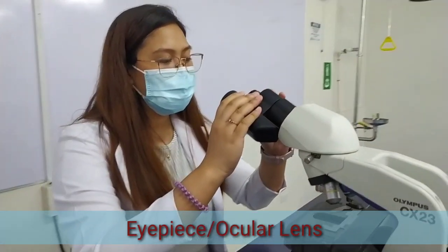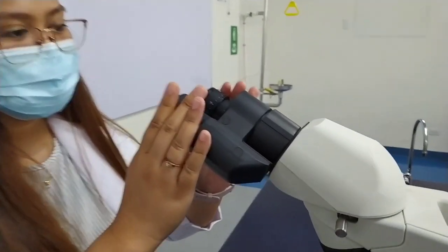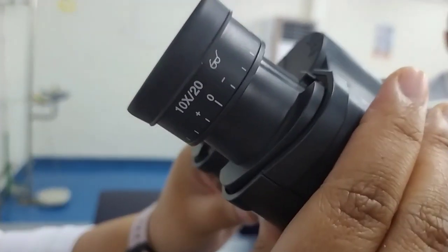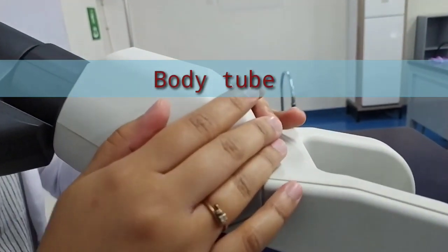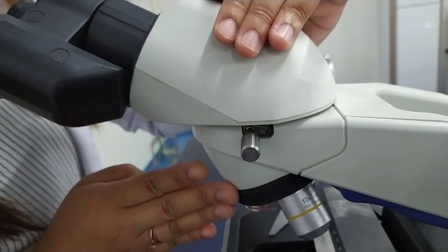Eyepiece or ocular lens. Eyepiece is the lens present at the top and is used to see the objects under study. Eyepiece lens contains a magnification of 10 times or 15 times. Tube. Tube or the body tube connects the eyepiece to the objective lenses.